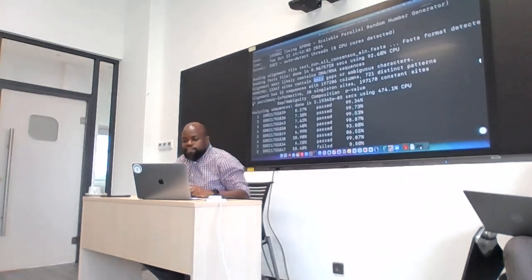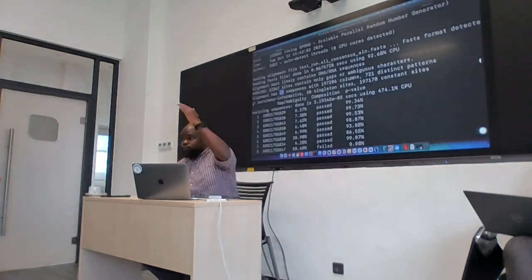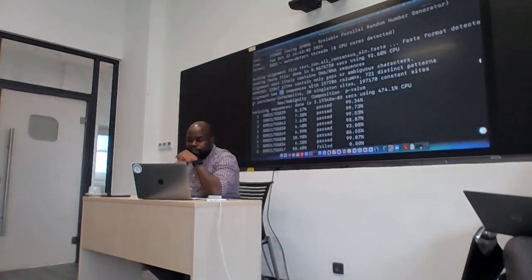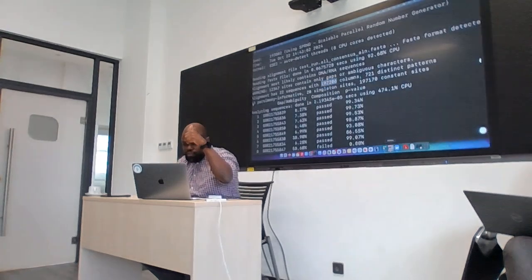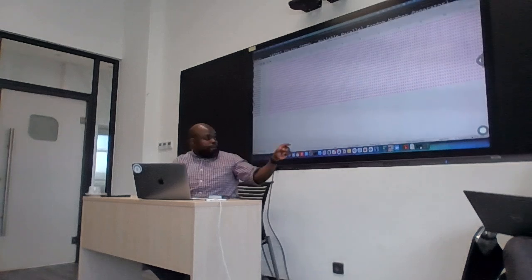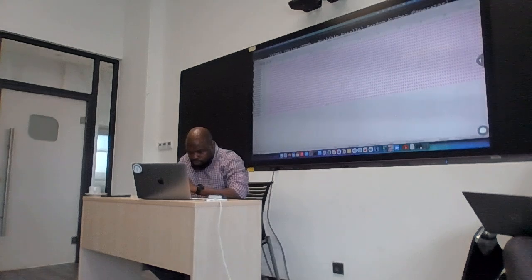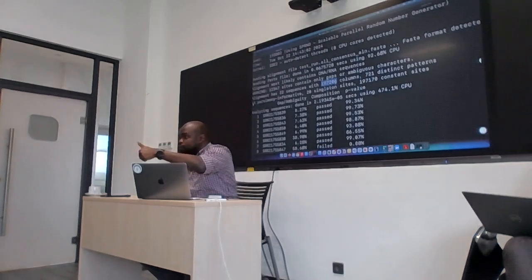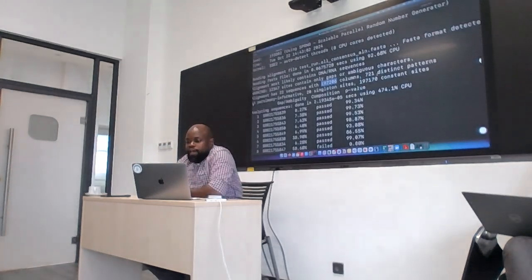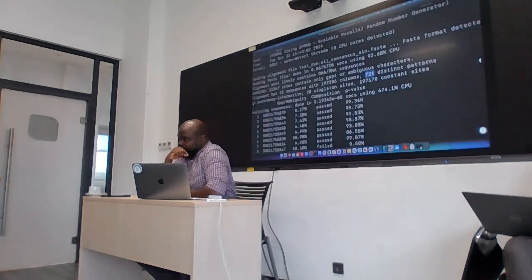Now, secondly, it's saying that the alignment has 22 sequences. And that's what we expect, right? Because we know we have 22 sequences, correct? And then it's saying it has 197,206 columns. Okay? We know that is true because if we go back to the earlier view, this is our alignment. At the bottom there, we see 197,206, right? If I go back here, it's 197,206. So that's the number of positions, okay? And then it's saying we have 721 distinct patterns, okay?